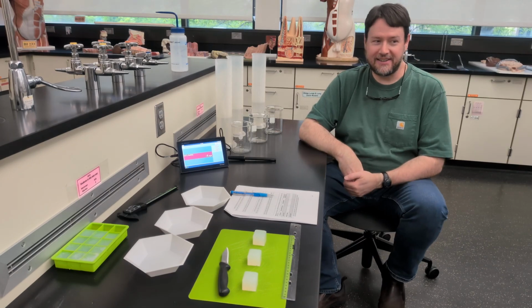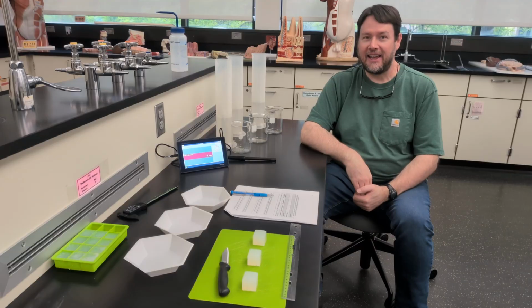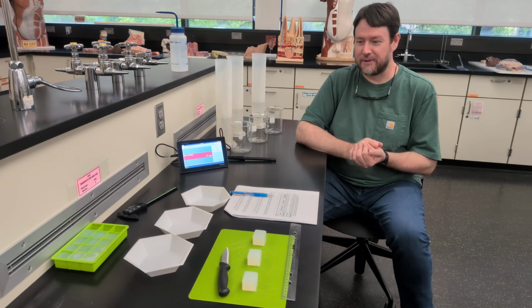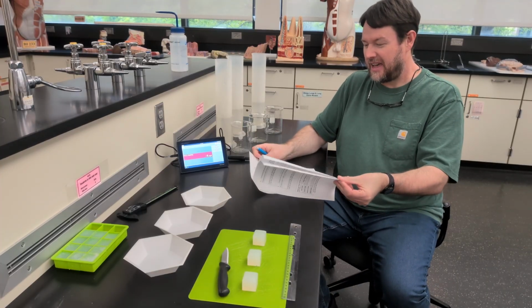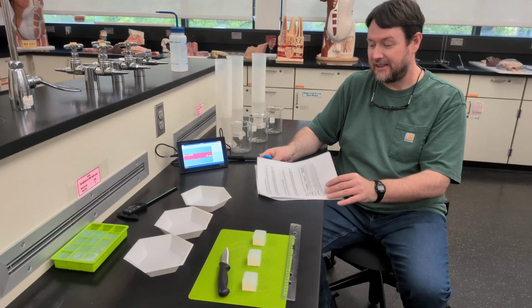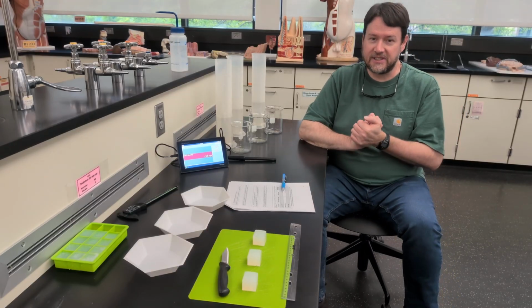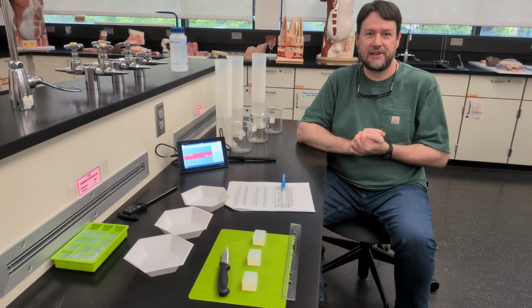Hi, I'm Brett, lab tech and instructor here at PCC Cascade, and today we are going to be doing a virtual walkthrough of the Biology 101 Lab 4, Exercise 2, looking at cell size and surface to volume ratio and seeing how that affects the rate of material export.